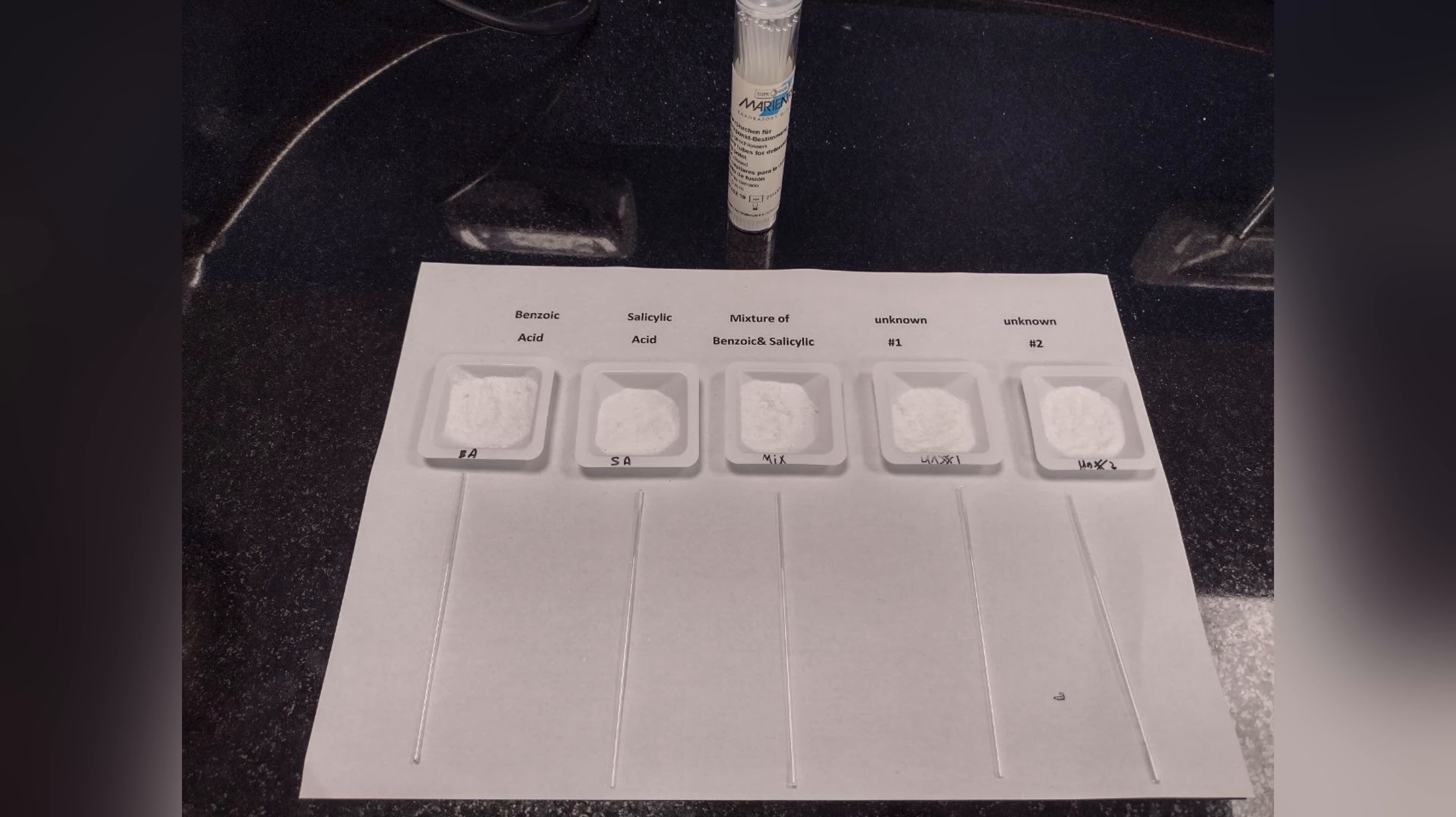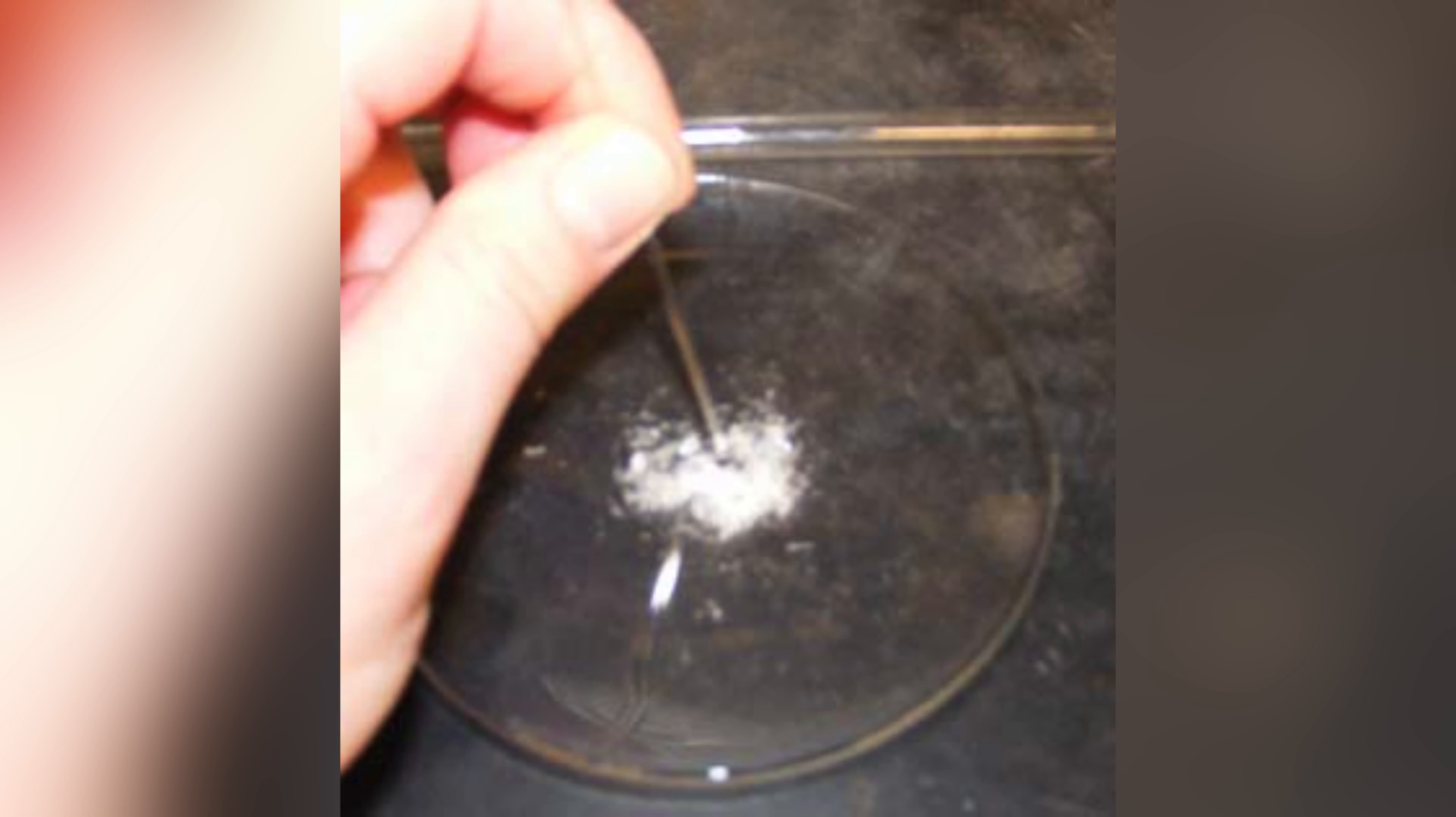The first thing we did to save time was putting the samples on the capillary tubes. The samples should occupy three millimeters or less to be more accurate.